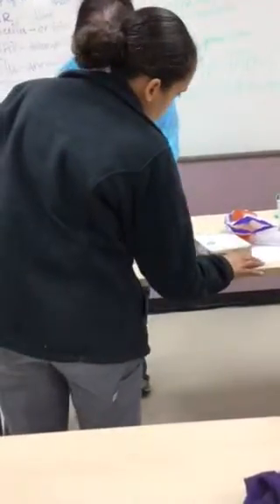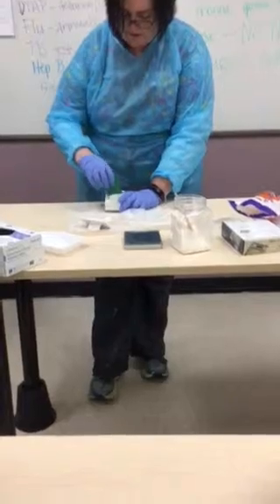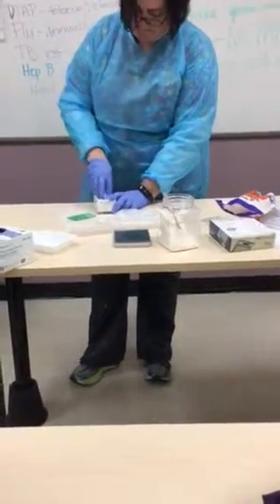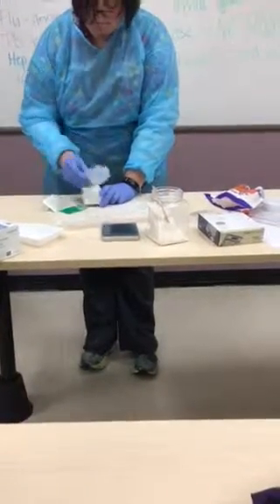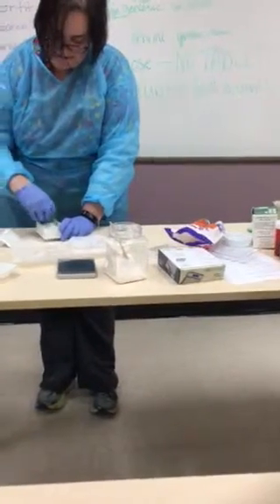I need to make sure that I get all the medication in these. Can you also write down 24 capsules, because that's going to come into play with the math. You guys get the gist of the idea — make sure that we have it all in there and that it's filled to the top.